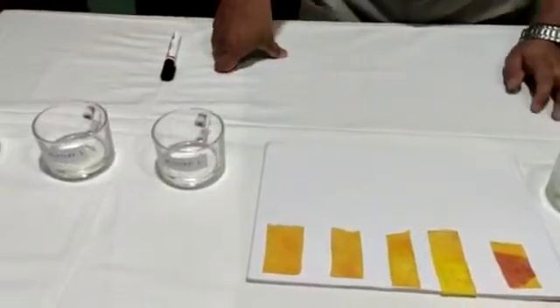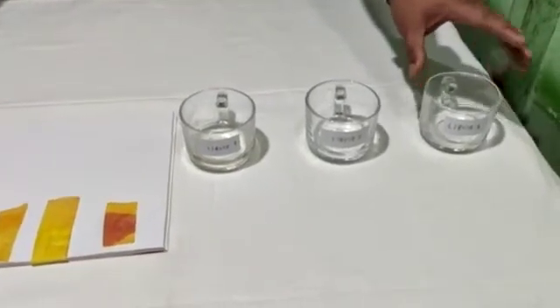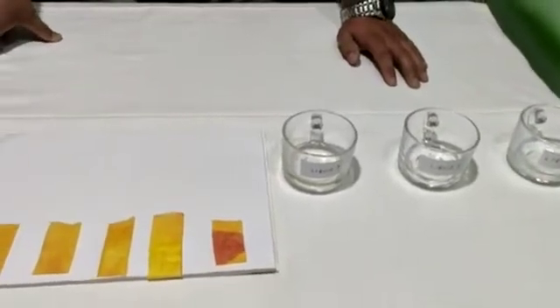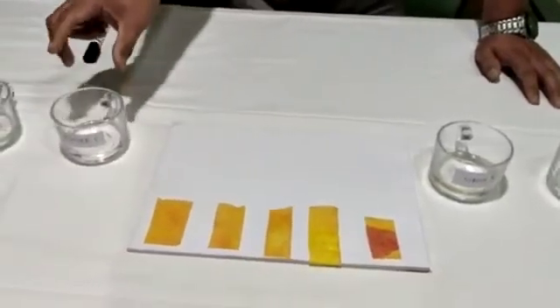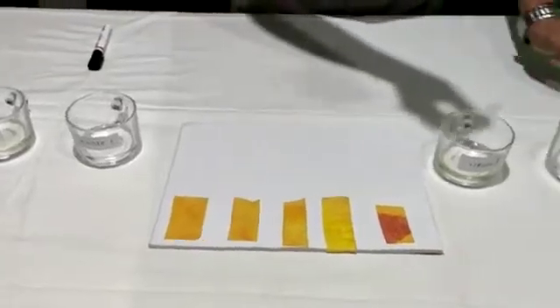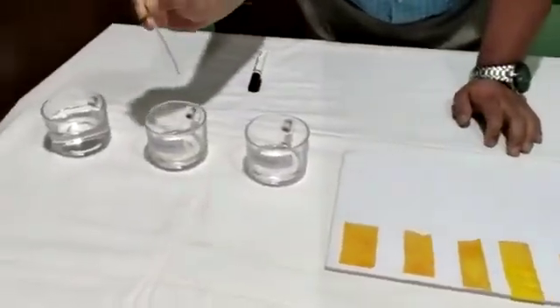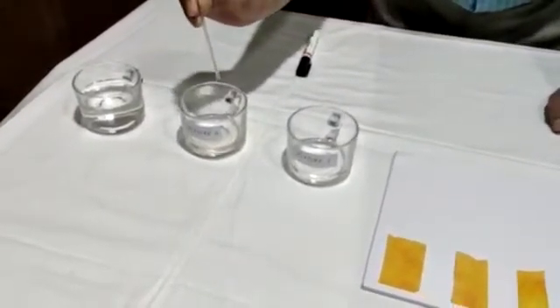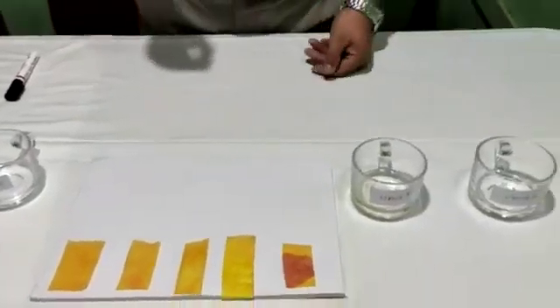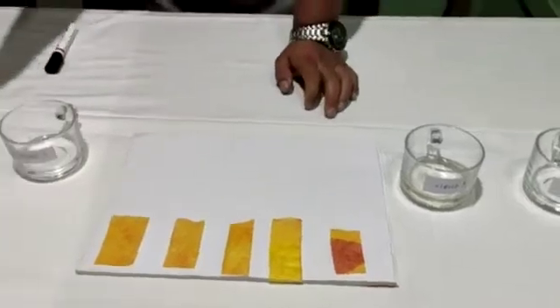We have finished making mixture 1 from liquid 1 and liquid 2. We have already confirmed liquid 1 is a basic solution, but liquid 2 — we still don't know what type of solution it is. We will see the effect of this mixture afterward. Now we need to make mixture 2. For this, we take one drop from liquid 1, which is a basic solution, and put it in the mixture 2 beaker. After that, we take one drop from liquid 3 and put it in the mixture 2 beaker as well.